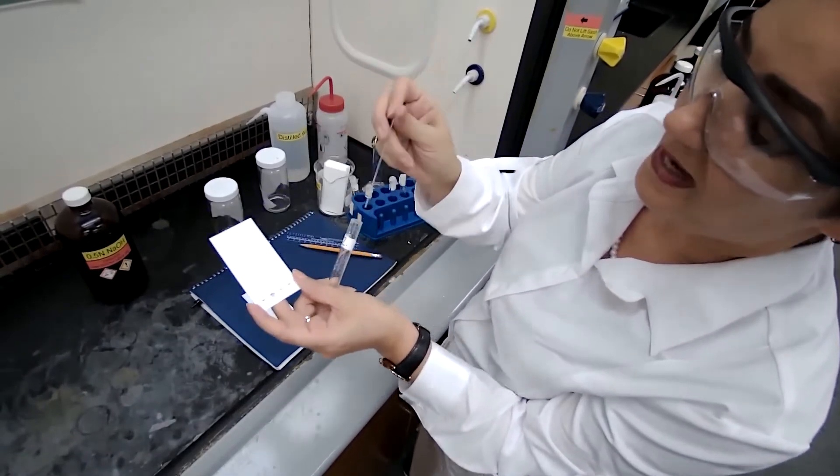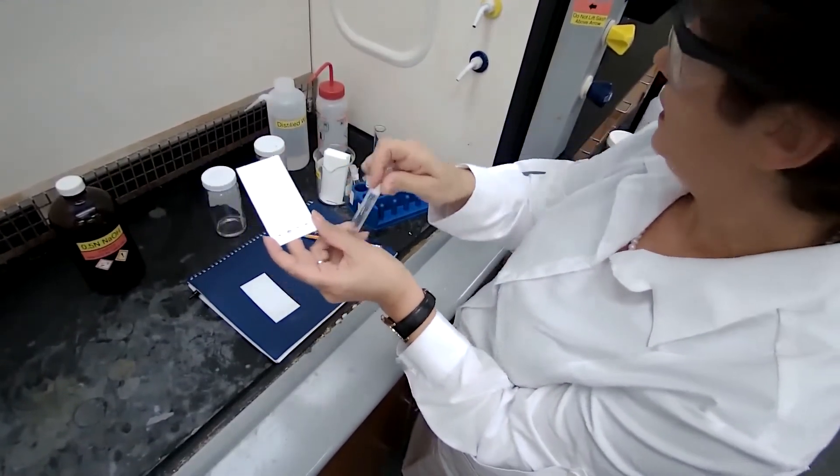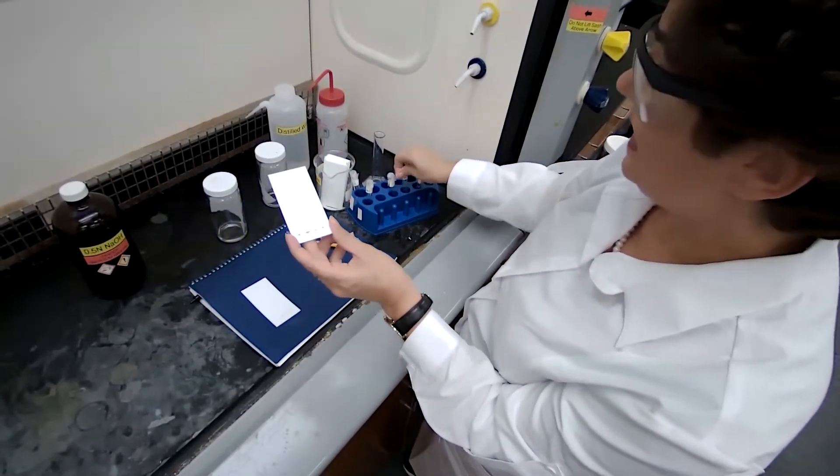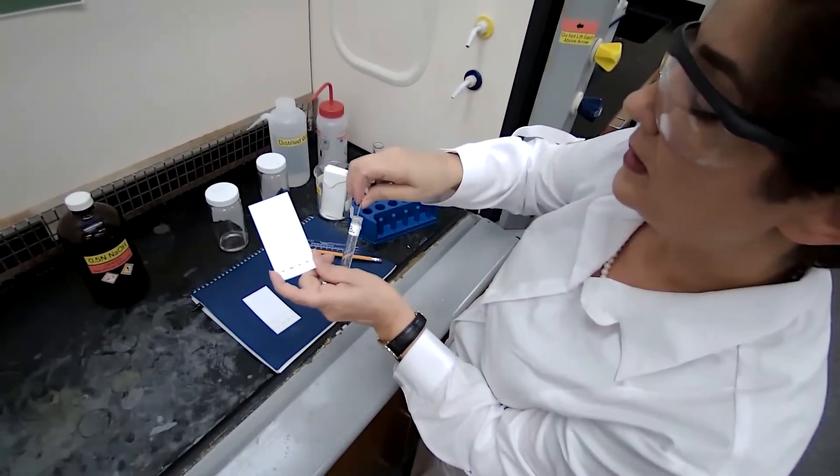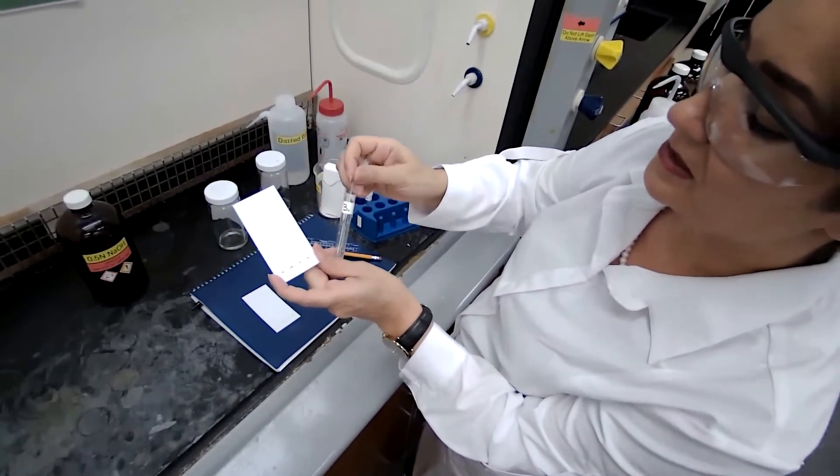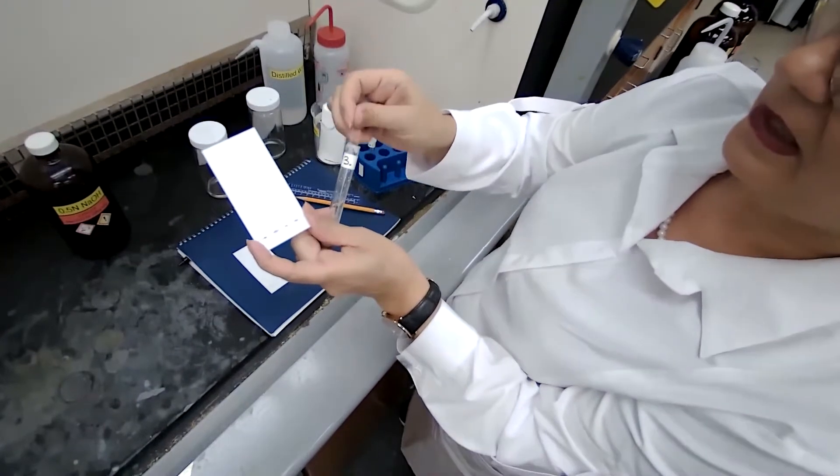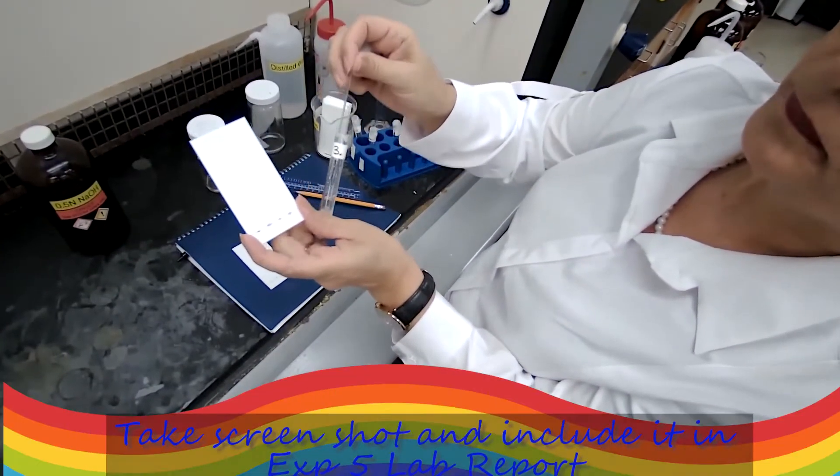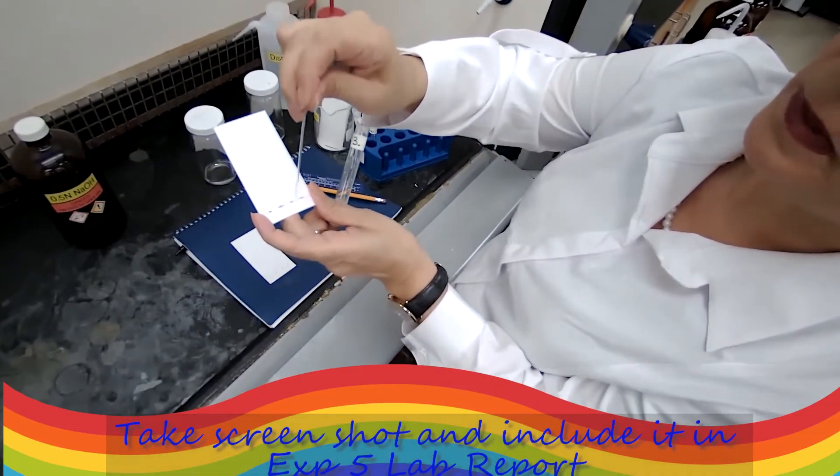Okay, now it's visible, you can see it. Then you move to the third sample. These solutions will be prepared by the lab, it's just the solution of those samples in alcohol, and this would be spot number three.